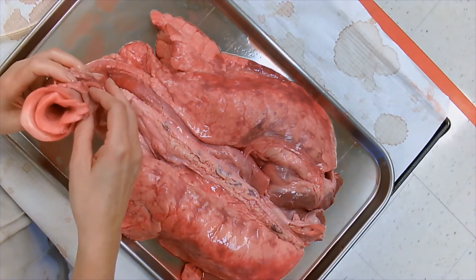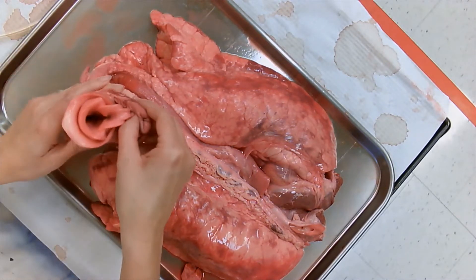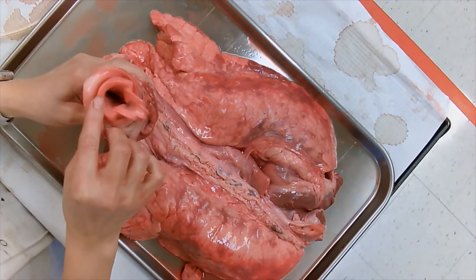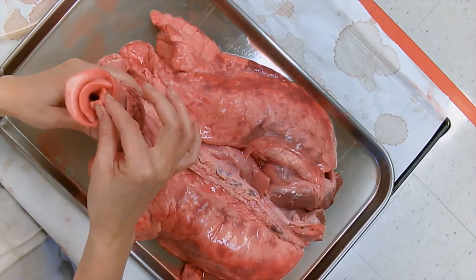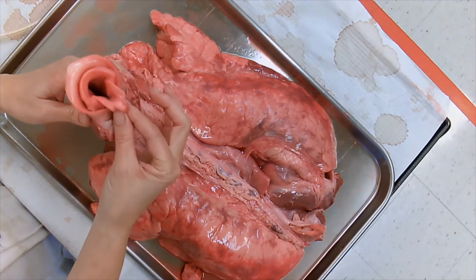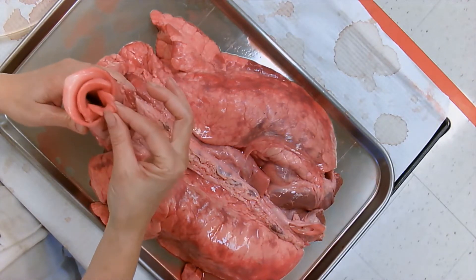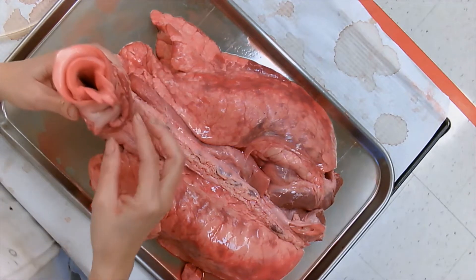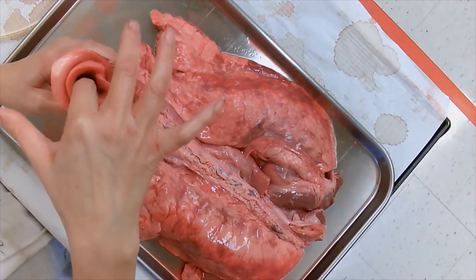If you're talking too loudly you can't hear what I have to say. So what I have here is the larynx, and also here I have this little part that you can see opens and closes. This little part is in the back of your throat and this is the epiglottis, because this is where the airway starts.